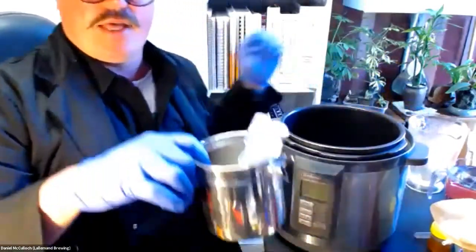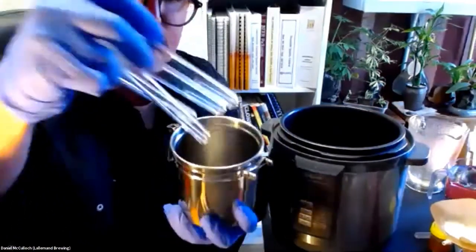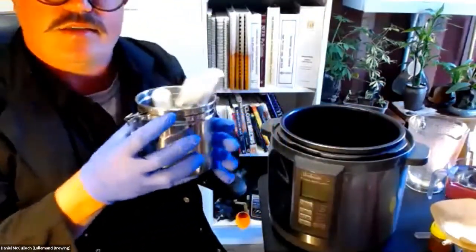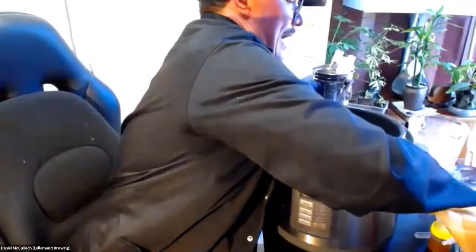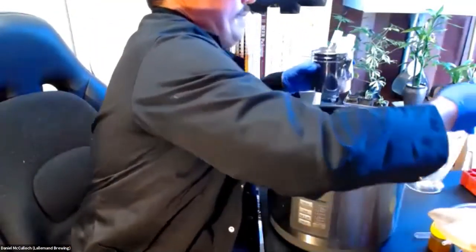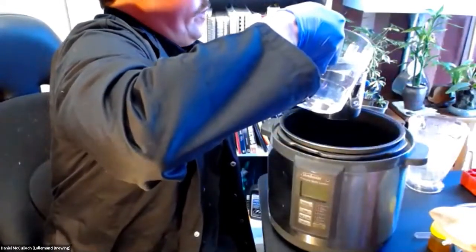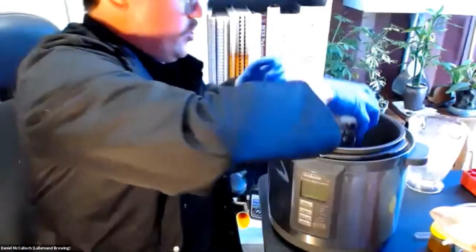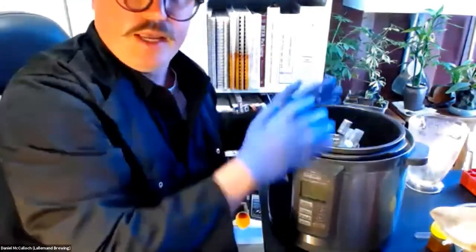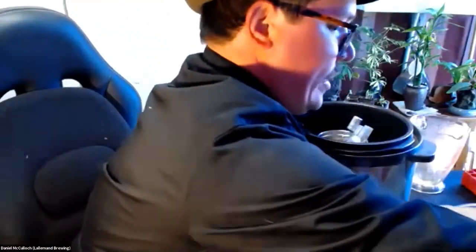You're then going to have, and this is just an old jar, where you're going to put your tubes in. Again, inside this, so that they're not floating around in that reservoir, you want to add some water into that, just to help with the heat transference. And when you've made up your tubes, you're going to put them into that pressure cooker, and put that on steam setting for 21 minutes.